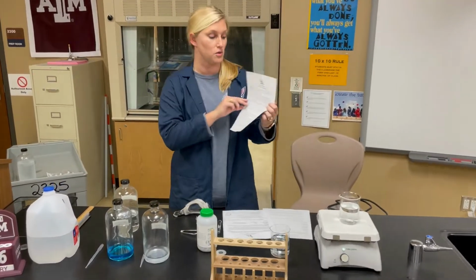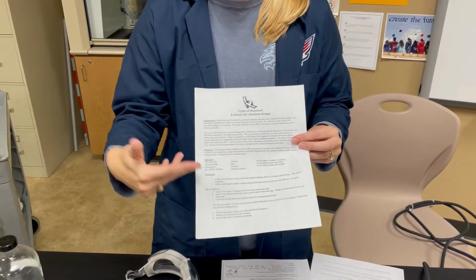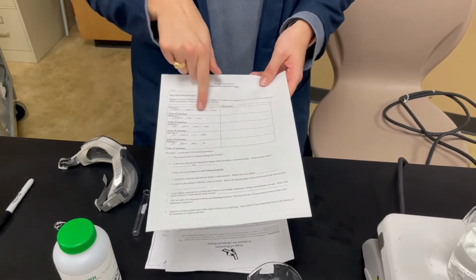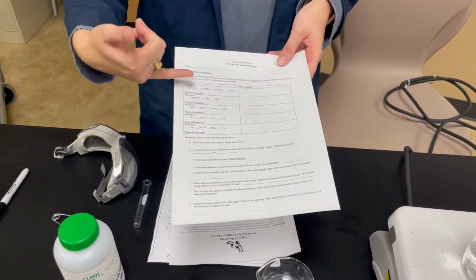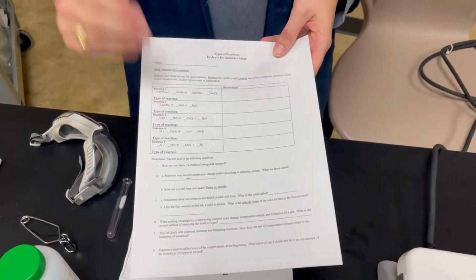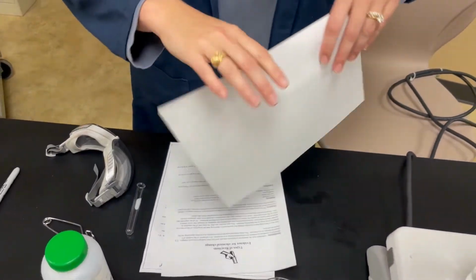The first is your types of reactions evidence of chemical change lab sheet. That walks you through all the steps that I'm going to be doing. So as you're going through this, you can follow along and see what I'm doing with my lab. The second thing that you're going to need, and this is the paper form of it, but these questions and these observations in this data table are going to be on Canvas next to this video. And so as we go through these types of reactions that you did in the pre-lab, you're going to be able to write the observations and balance them. So you have seen these reactions before, now we're going to actually see them in person.